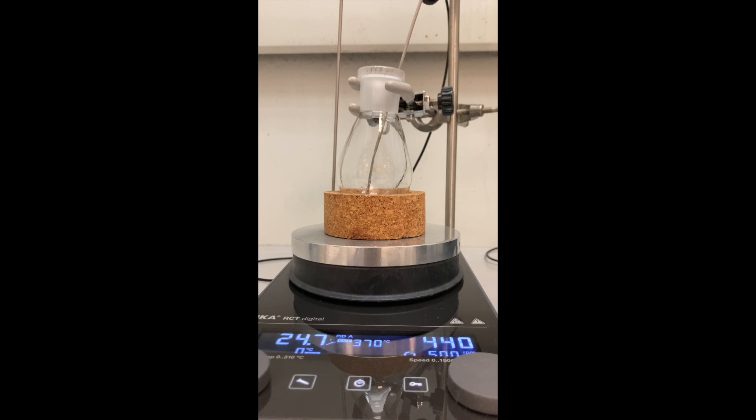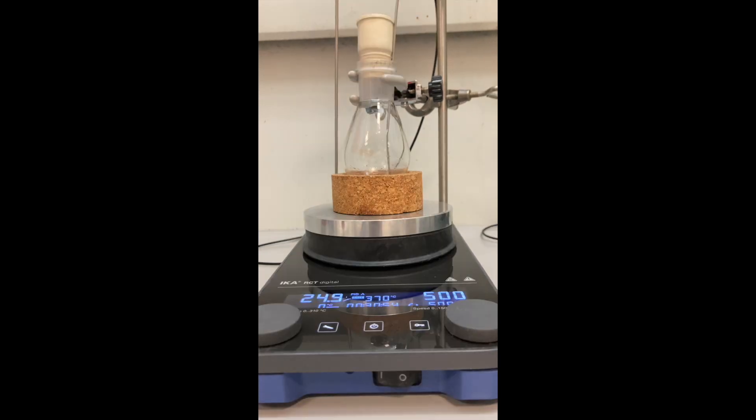However, the amine was glued to my spatula, so I left it there and switched on the stirring. After half an hour or so, the solution was clear and my spatula was clean.